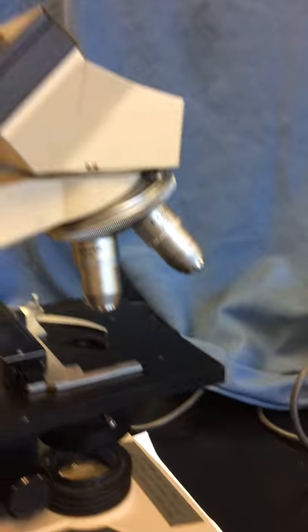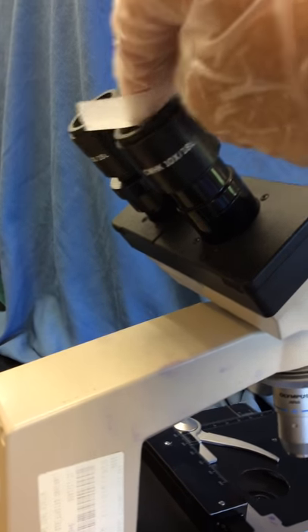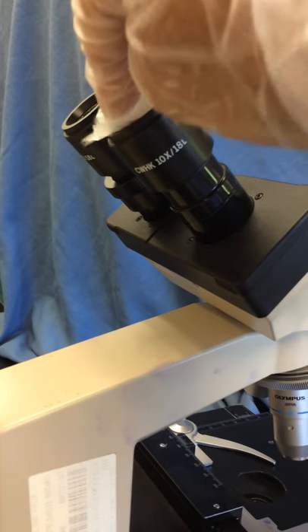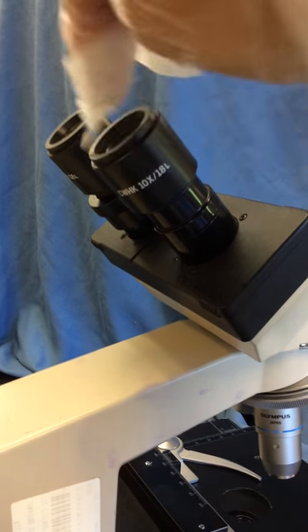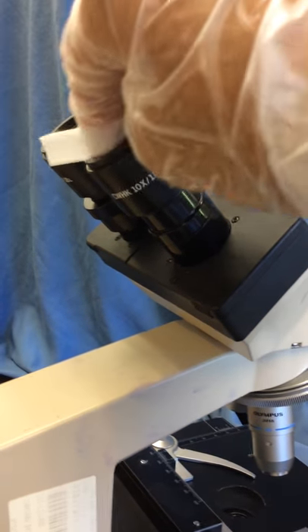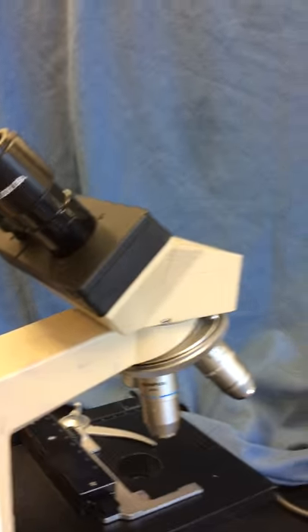We use a separate piece of lens paper to clean the ocular lenses. Oils from our eyelashes can dirty the ocular lenses. If folks are wearing makeup, the makeup might be transferred to the ocular lenses. So that's really important.